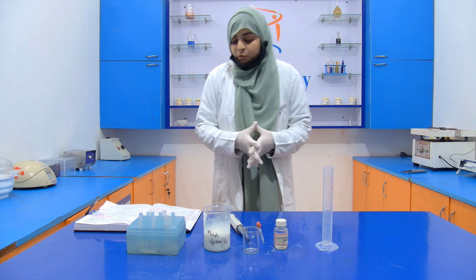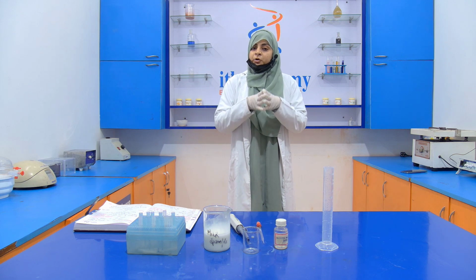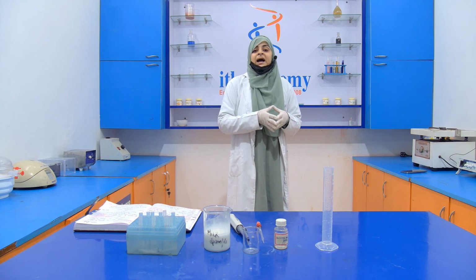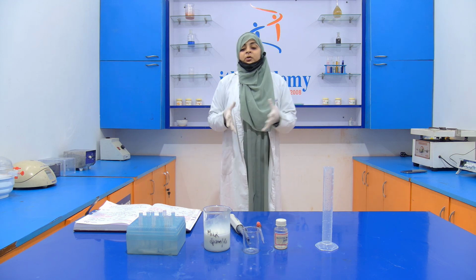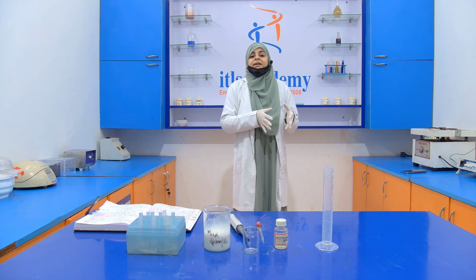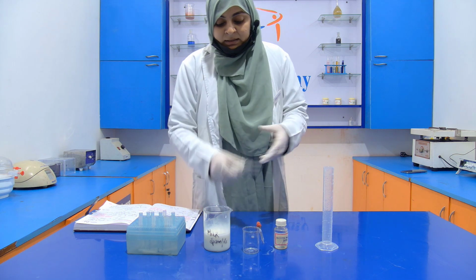So here what we have to do, we take 5 ml of milk and into it we add concentrated HNO3 drop by drop. Okay. Then after that we observe a color change in the milk. If orange color appears, then it means that skim milk is added into the natural milk, and if yellow color appears, then it means that there is no adulteration of skim milk in the natural milk. Okay, so skim milk, I already told you, is milk in which the fat content is low or sometimes even negligible. So let's start our experiment.